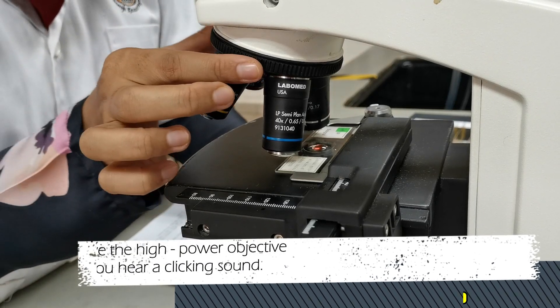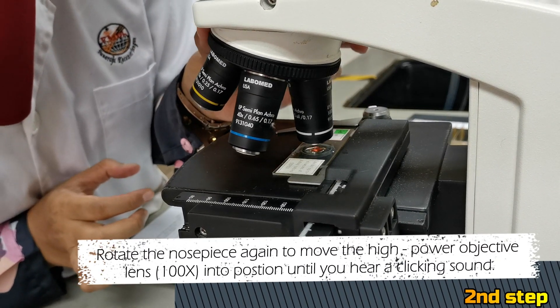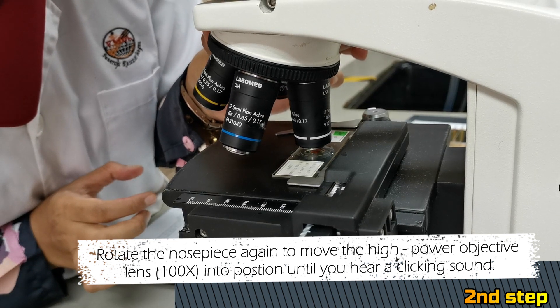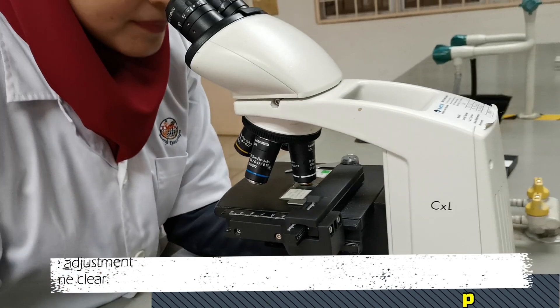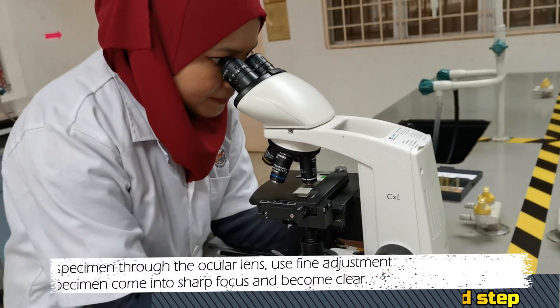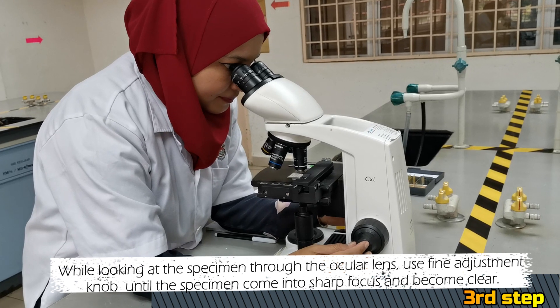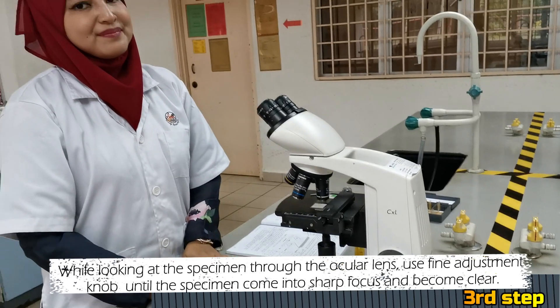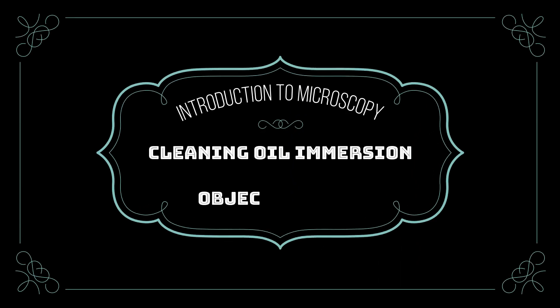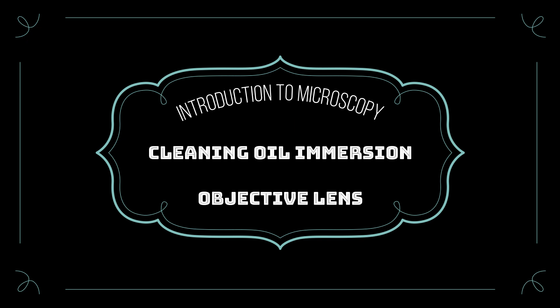Second, rotate the nosepiece again to move the high power objective lens into position until you hear a clicking sound. Third, while looking at the specimen through the ocular lens, use the fine adjustment knob until the specimen comes into sharp focus and becomes clear. Lastly, when you have finished using the oil immersion objective lens, do the following steps.